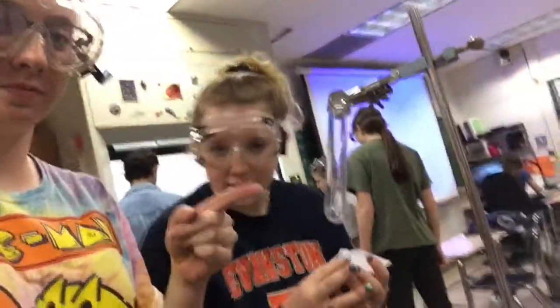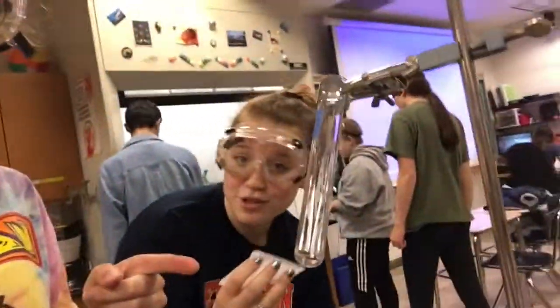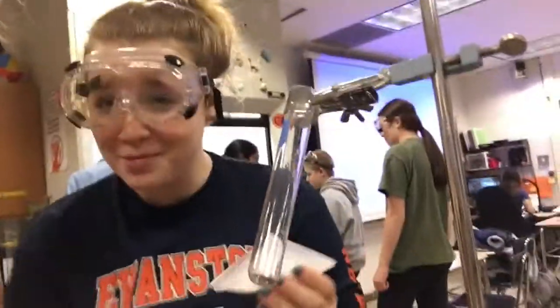All right, we got it. The next thing we're going to do is take this 6.27 grams of potassium chlorate and put it into the test tube.